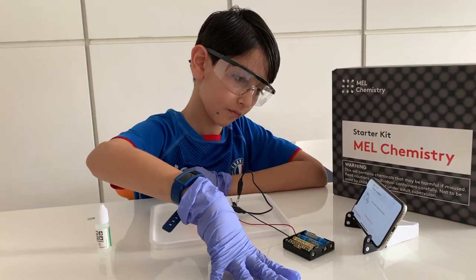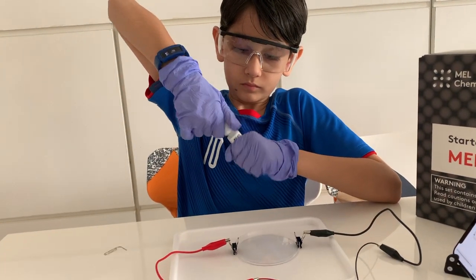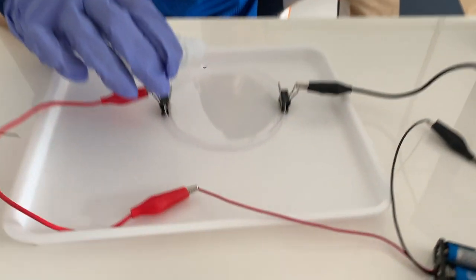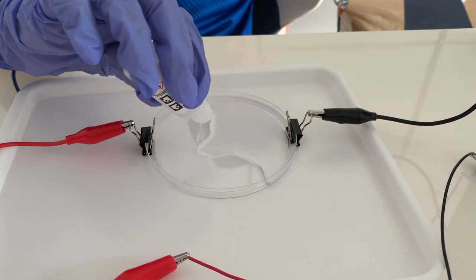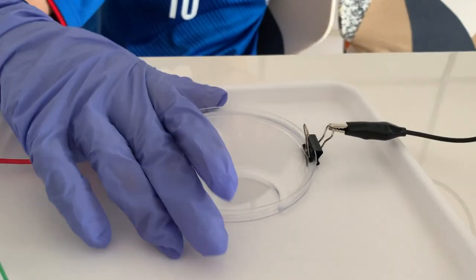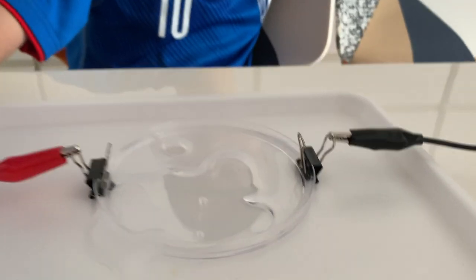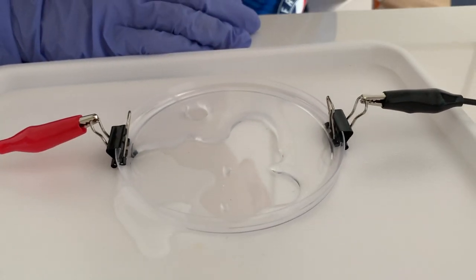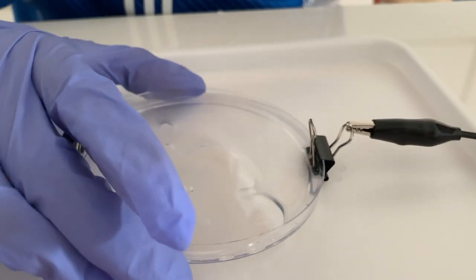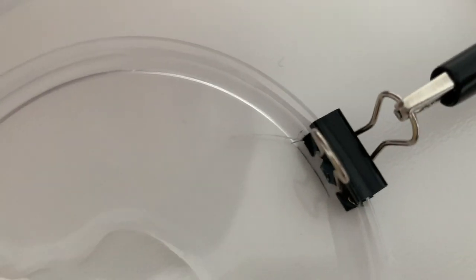30 seconds over, so it's time to pour the solution into the petri dish. I'm so excited to see the metal tree. Is it difficult to open? Let me help you. And we can see that the metal tree has begun to grow!